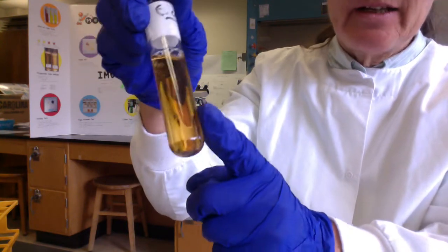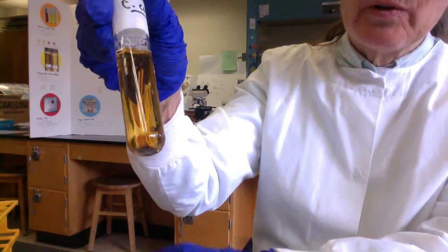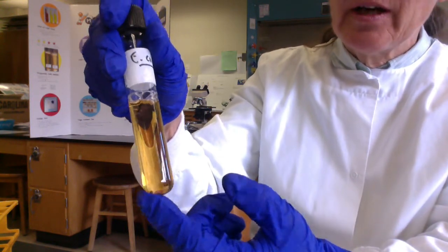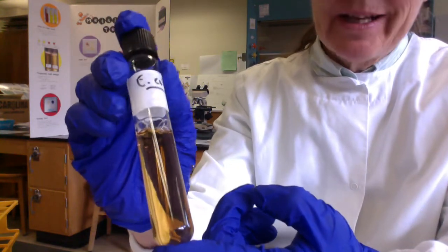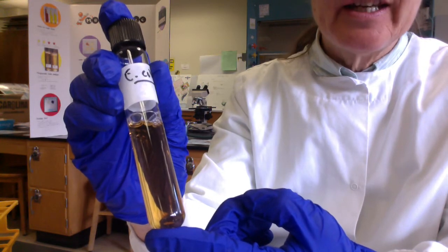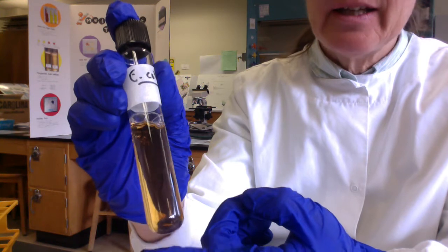So had I inoculated this with E. coli and after incubation it's transparent, I would call that a failure of transfer, and this does happen. So we'd want you to know what are reasons for failure of transfer. Well, one thing is maybe you forgot to inoculate it, right? The second thing is maybe your stock culture is dead, right? The cells that you transferred are dead.